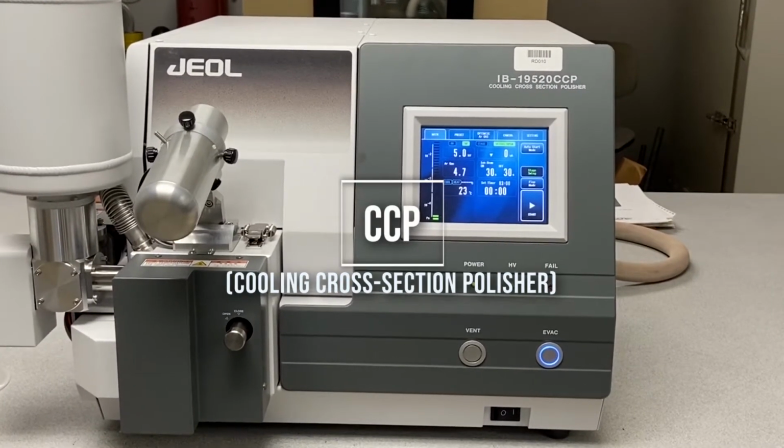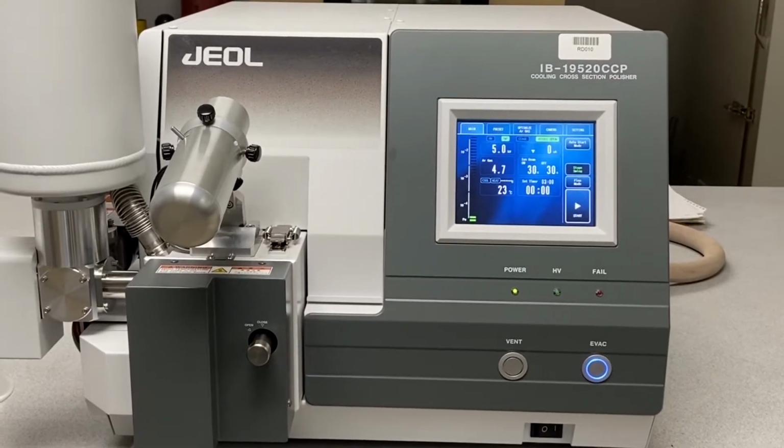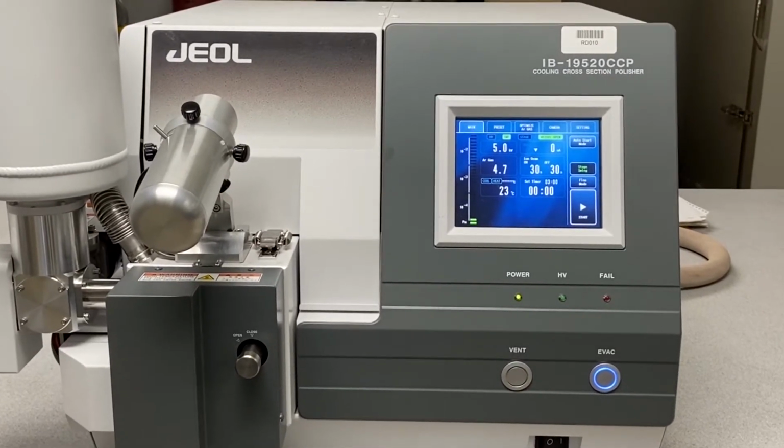The Cooling Cross-Section Polisher, or CCP, uses an argon beam to finely mill samples for better imaging in the SEM.